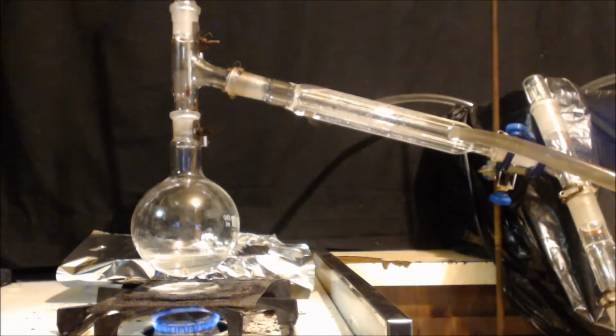So I'm just set up for simple distillation. I left that copper sulfate in there, that way, in case any water can absorb it. You can see, it's coming over. A little cloud there. I actually might have to turn it down here a second. You can see the vapors. It's actually a great shot.